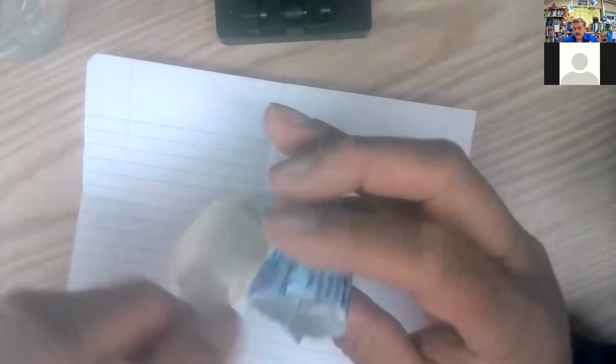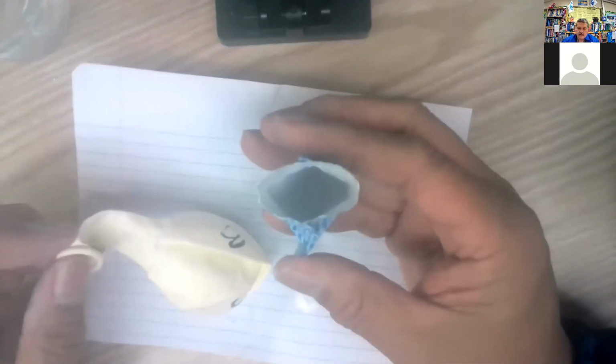The envelope there, so I get the rest of that in there. Okay, good. Probably not a significant amount right there. Let's get it anyway.